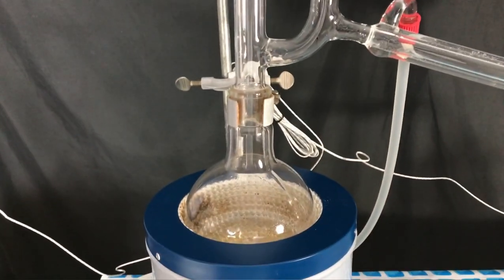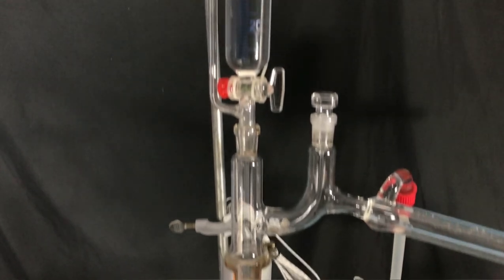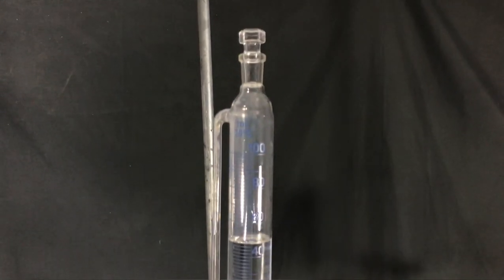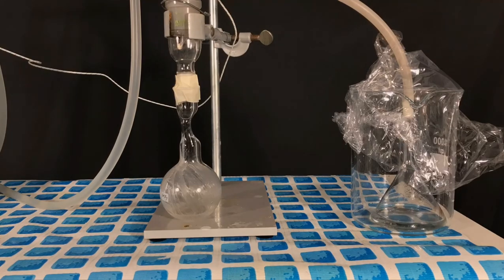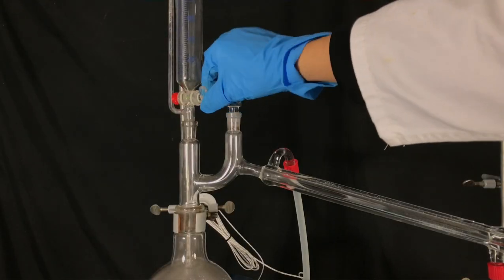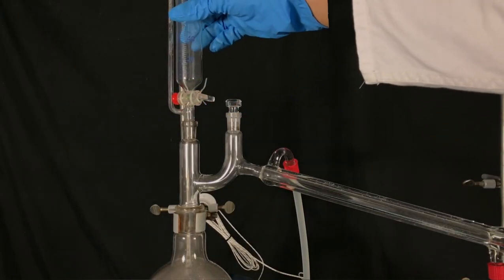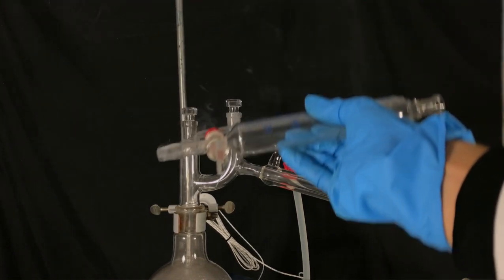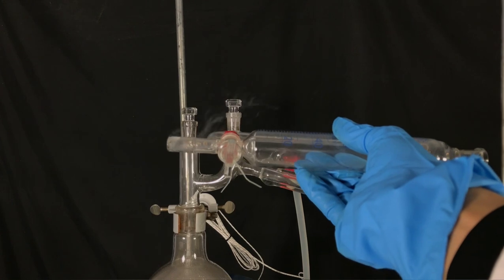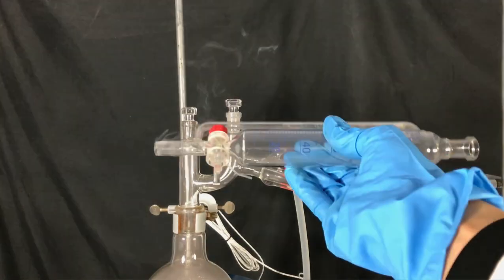To add the final milliliters of sulfuric acid the heating mantle was turned off somewhere in the middle of the procedure and the rest of the sulfuric acid was added via an addition funnel. Without the use of an addition funnel a lot more sulfur trioxide vapors would leave the apparatus as you can see here. A dense white fog of concentrated sulfuric acid and sulfur trioxide.